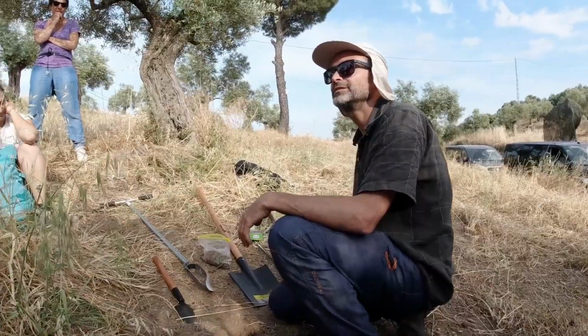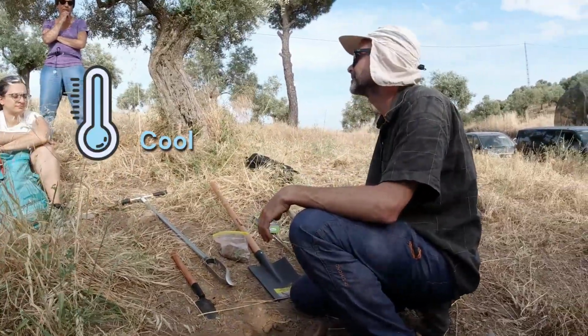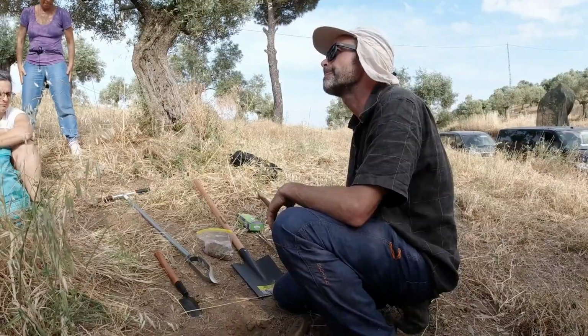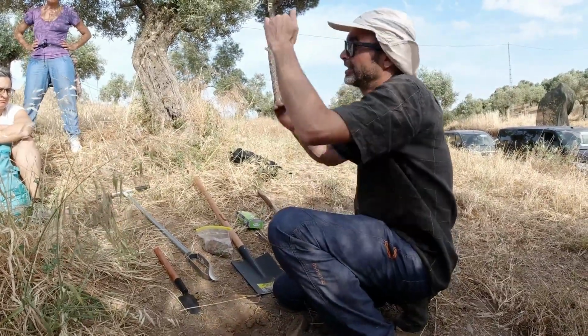Brush excess soil from tools between sublocations to avoid cross-contamination. Keep samples cool and out of direct sun. Deliver to the laboratory as soon as possible and follow lab guidance for storage and any biological analyses, which may require different handling.